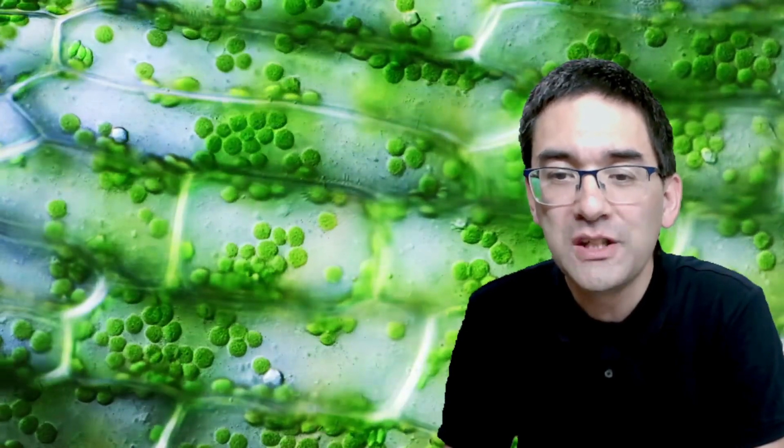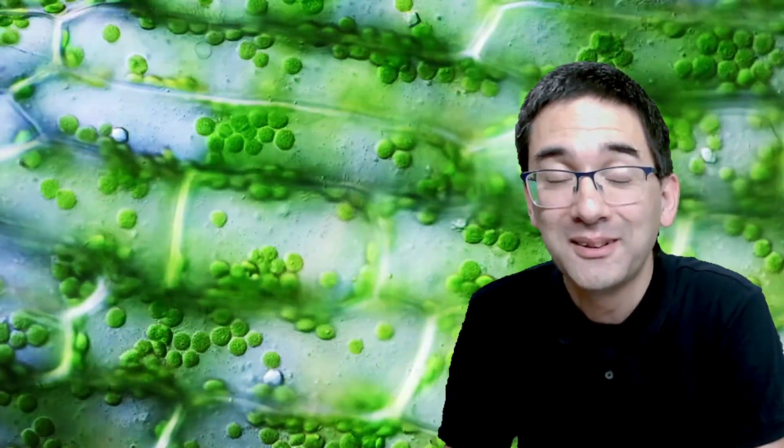And we can see that there is not only one chloroplast in there, but there are many of them, obviously, doing photosynthesis, and they move. There is quite a bit of movement going on here. And you can also see the cell wall. You can see the individual cells as well, because they look a little bit like bricks. And inside the cells, you see those structures. There must be also somewhere the nucleus. Difficult to see because it's transparent. But don't worry, it's there. The green chloroplasts are easy to see because, well, they're green, okay? So that's why I like this a lot, because it's easy to observe under the microscope.